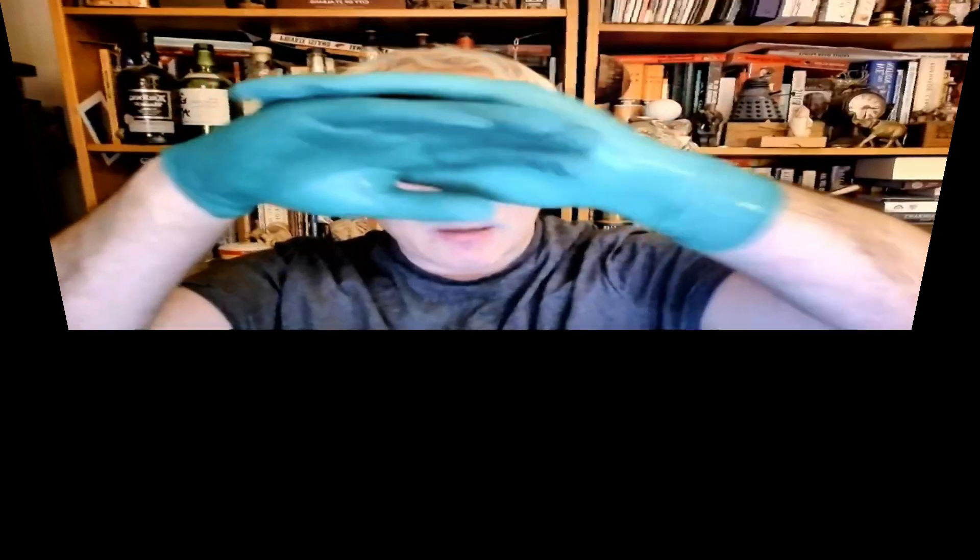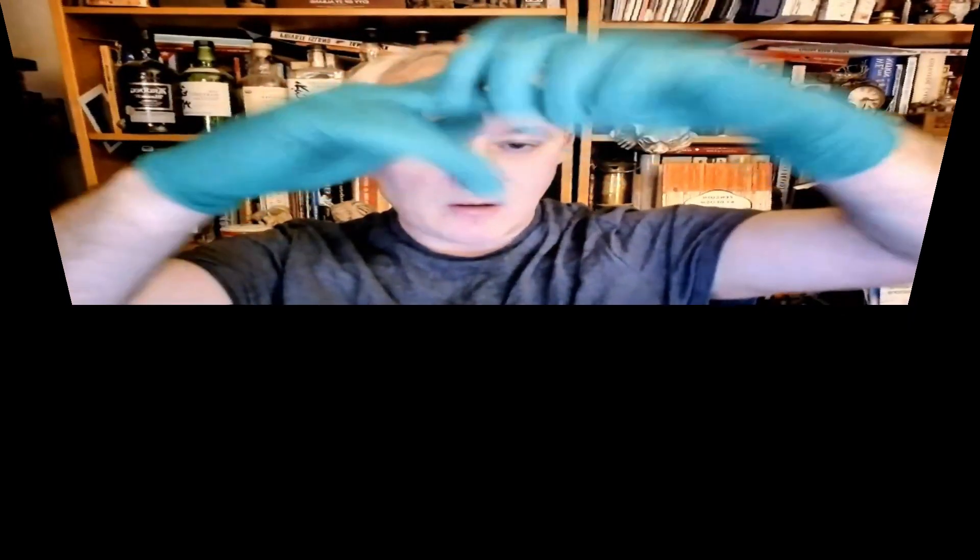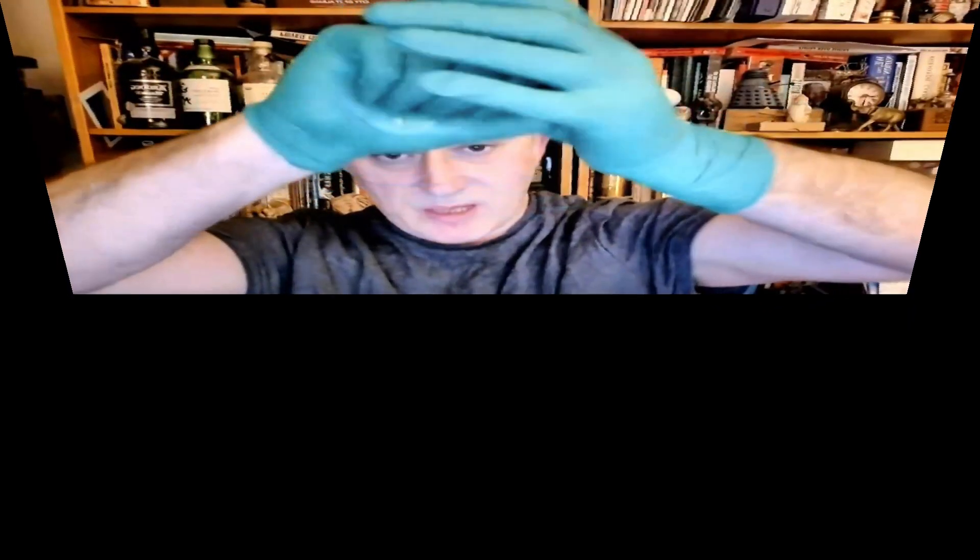It's really important that I begin by rubbing it into the palms of the hands. Now I want to make sure the other side of the glove is also receiving an application of the hand sanitizer. I need to make sure I'm applying it over the lengths of each finger and thumb on both hands, really making sure it reaches all of the surfaces.